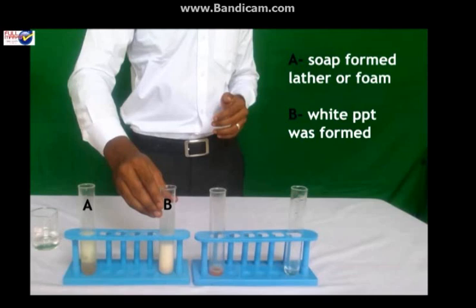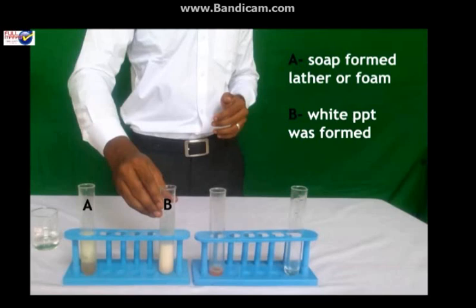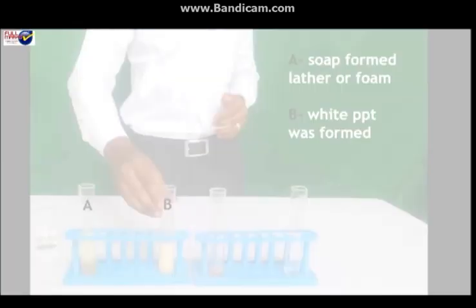Observation: In test tube A, soap formed lather or foam. In test tube B, white precipitate was formed with no lather or foam.